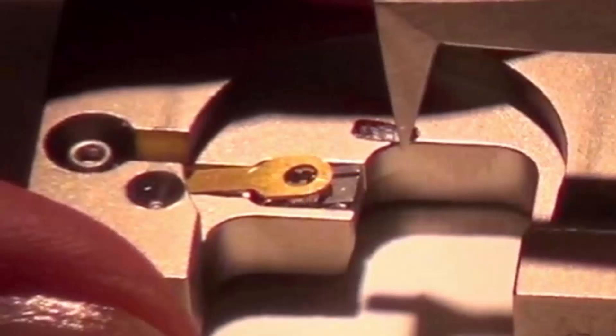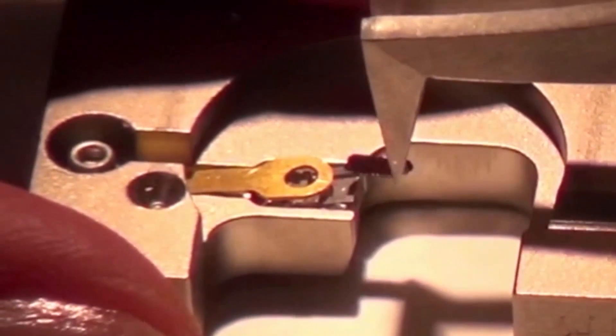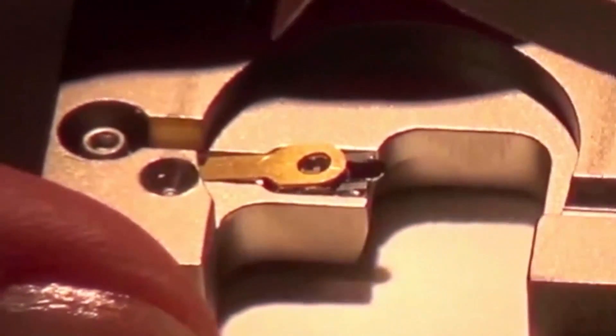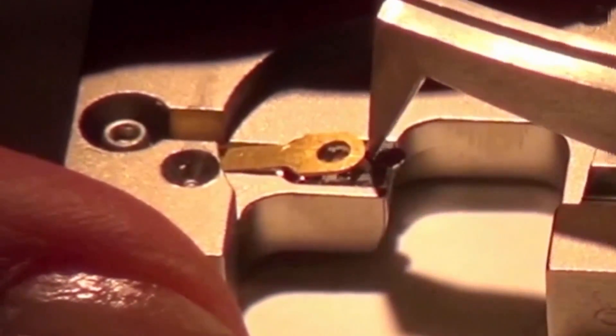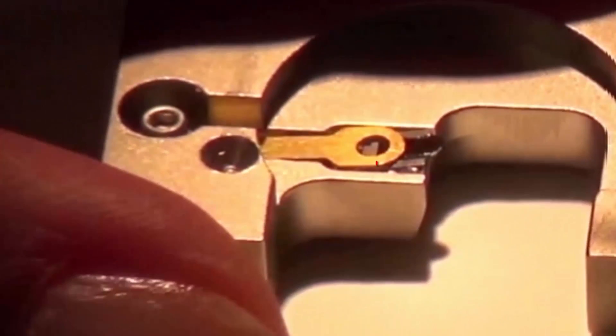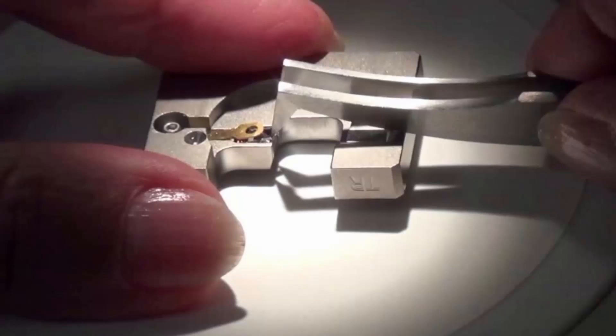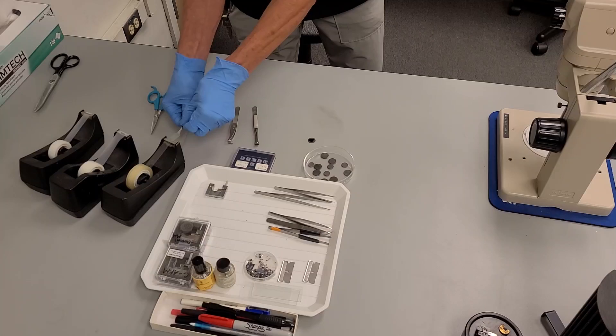Position the probe to the top left corner of the recess using your tweezers. To remove the probe, carefully grip the front of the probe while pushing down on the holder to raise the clip.